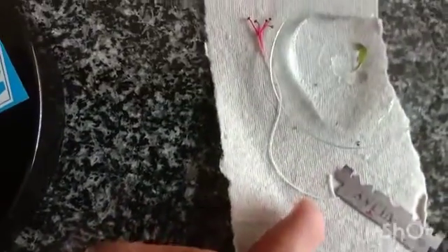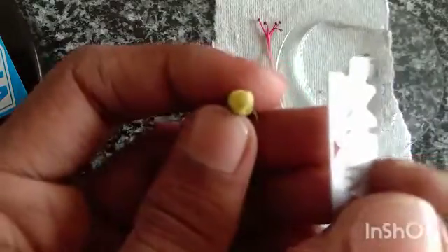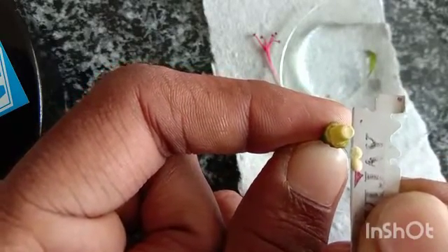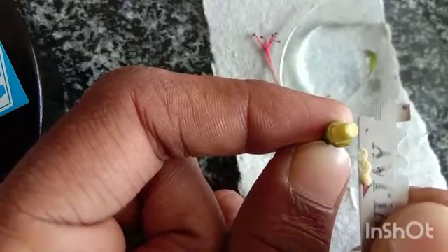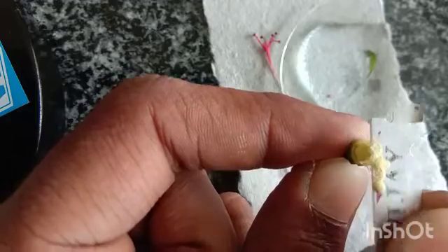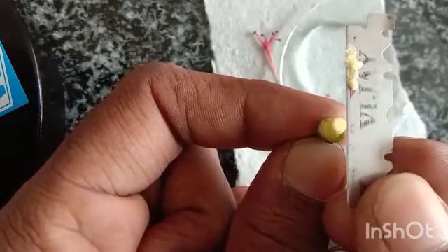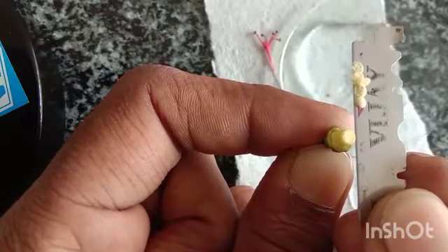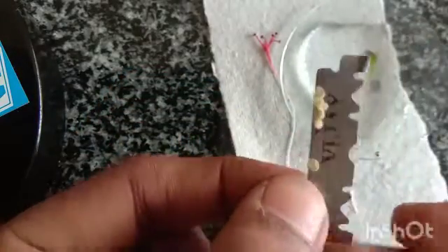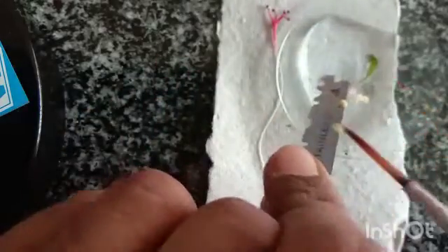Take some water in a watch glass and take the transverse section of ovary with the help of sharp blade. You have to take a very thin section. Like this you have to cut the ovary. Take a thin transverse section. And transfer them to the watch glass with the help of brush. Transfer them into the watch glass which contains water.